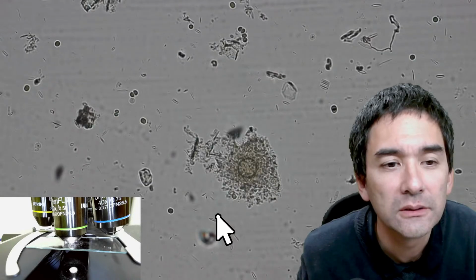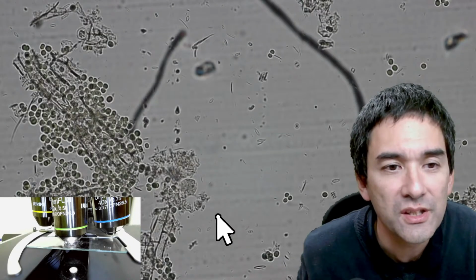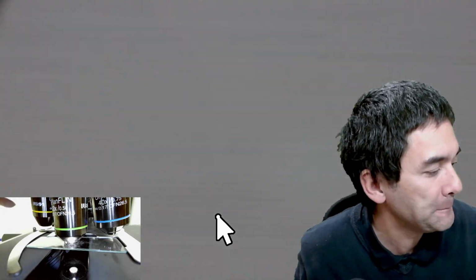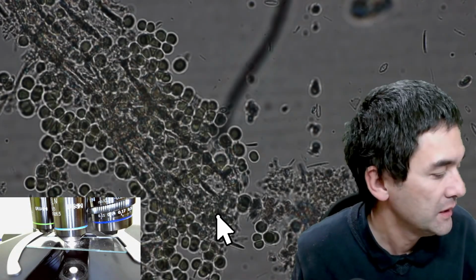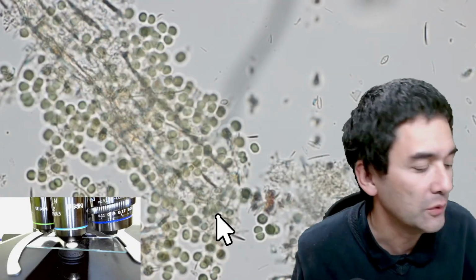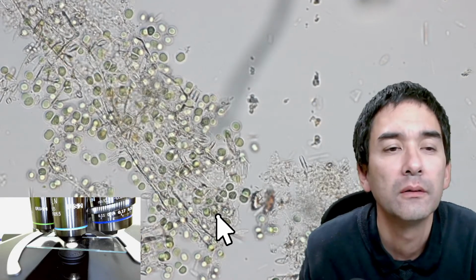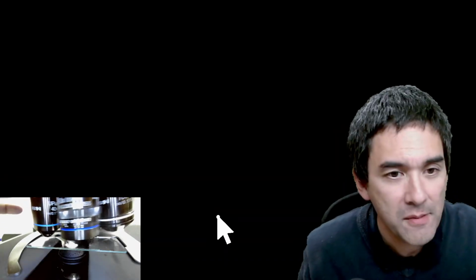Or anything else here. Let me just find something of interest. I don't know. Otherwise, I'm just going to stay here. Okay. So let's move up. This is now 40 times. You know what I'm going to do? I'm going to put in the condenser again because I have to have a little bit more clarity. So I now switch over to 60 times.